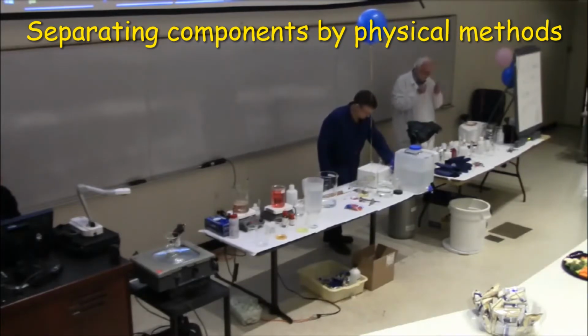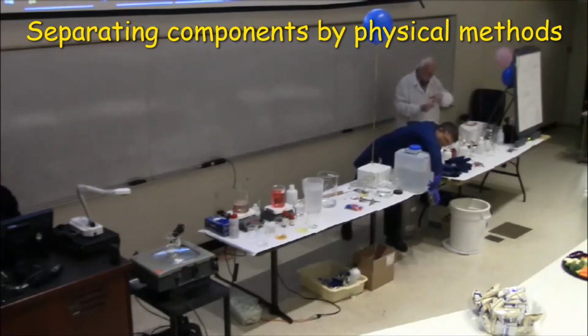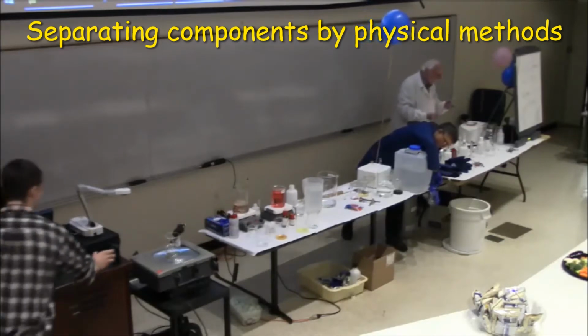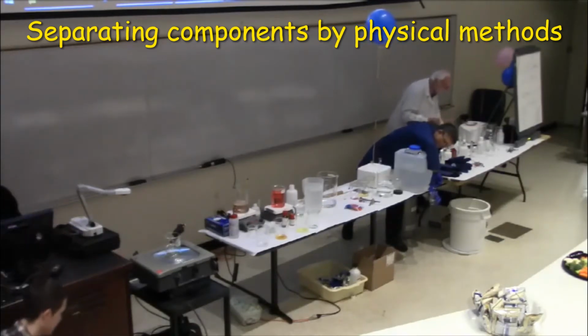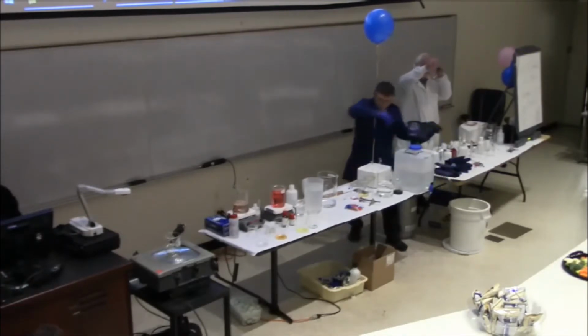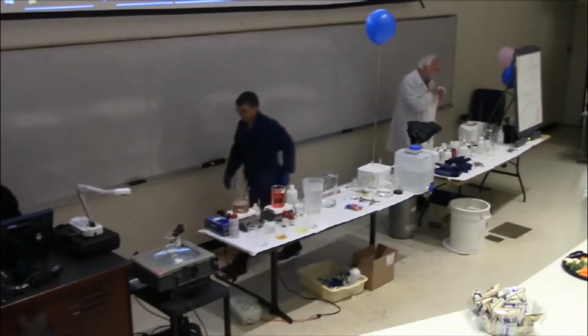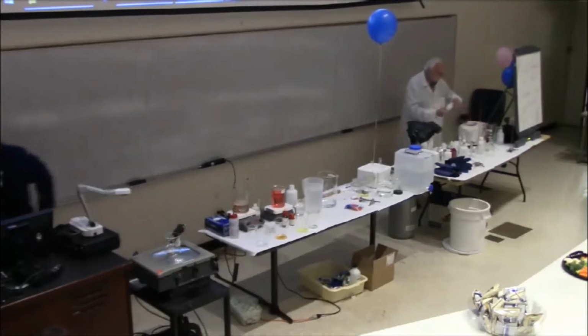So let's, I'm going to add some iron to this mix. Now we have 3 components in this. And how can we separate the iron from these other 2 materials? What's the property of iron? Magnet, very good. This just shows that that really works.